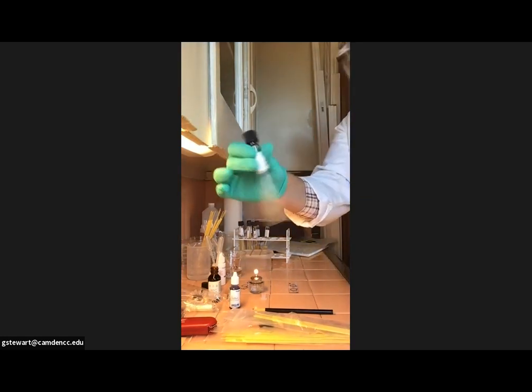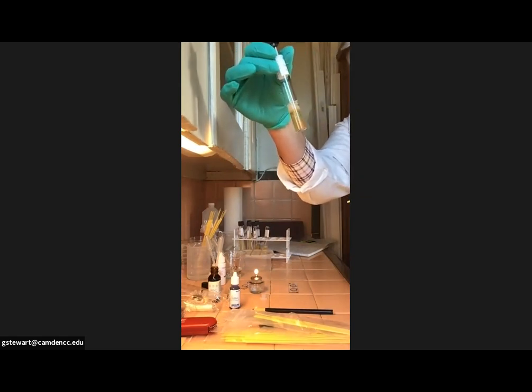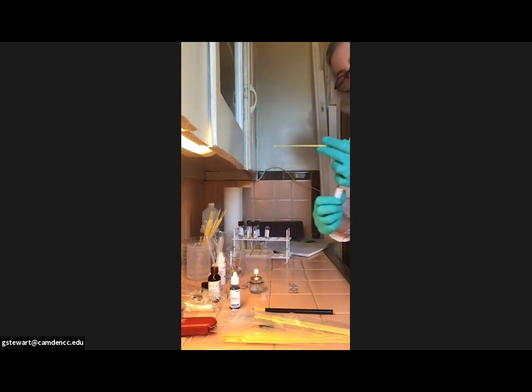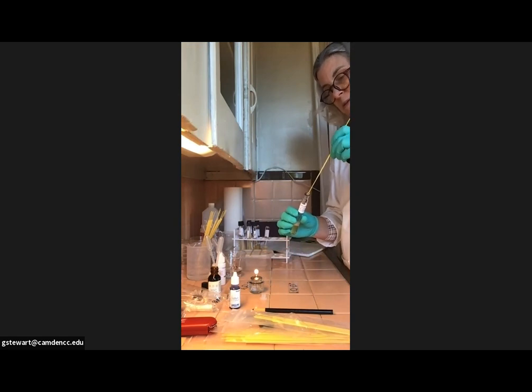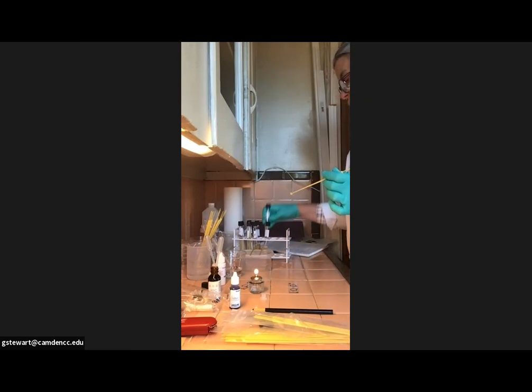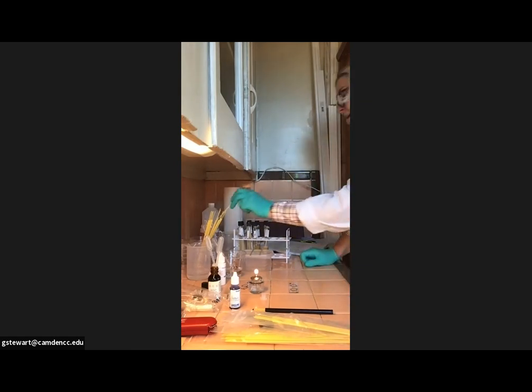So this grows the most slowly, and you can probably tell amongst your own cultures that this one is a lot less turbid or less cloudy than the others. So I'm trying to be sure that I give this a really good shake because the bacteria are probably set in the sediment at the bottom of the tube. Unscrew the cap by turning the vial, not the cap, flaming the top, inserting, picking up a loopful of bacteria, flaming, closing by turning the tube, replacing the tube in the rack, and this goes in my last circle here. Okay, excellent. And then I'm going to pop that right into my isopropanol jar.